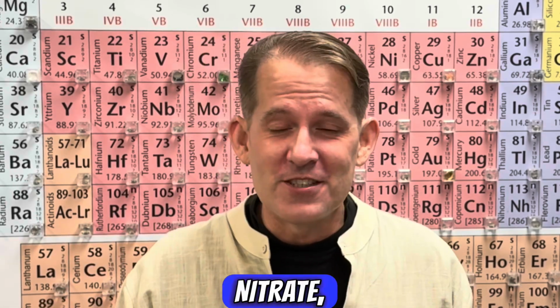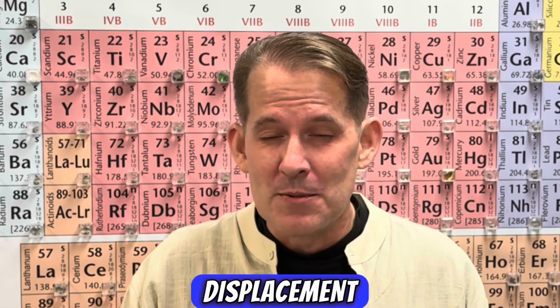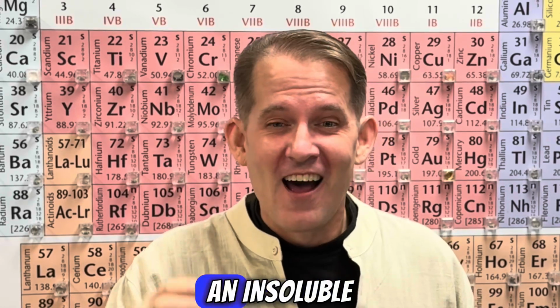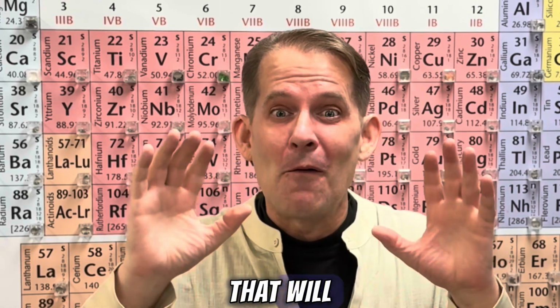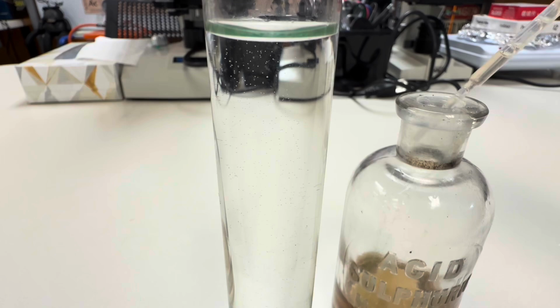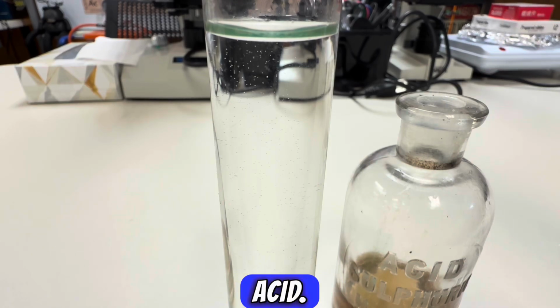When you add sulfuric acid to your solution of lead 2 nitrate, it's going to create a double displacement reaction, and you'll see the precipitate of lead 2 sulfate, an insoluble white solid that will fall out of the solution. Check it out. Okay, here's a few drops of concentrated 18 molar sulfuric acid.